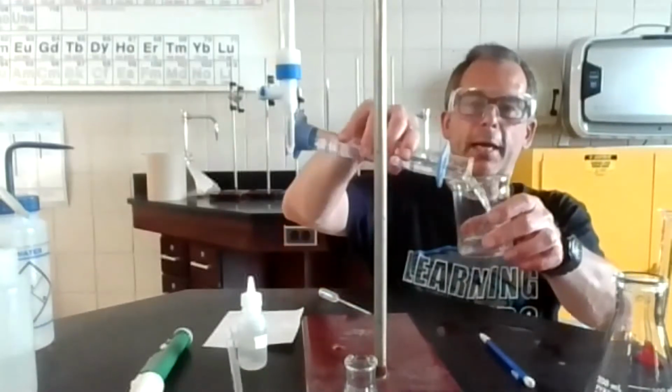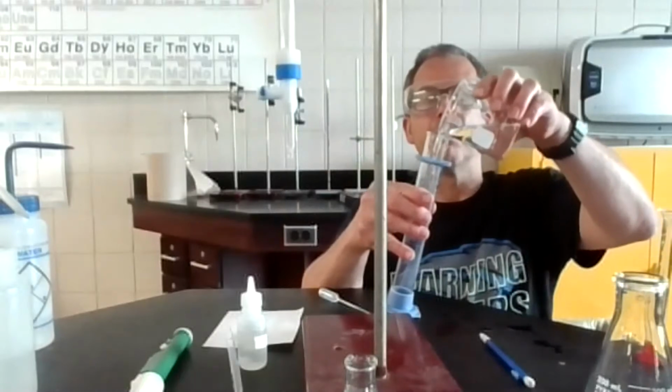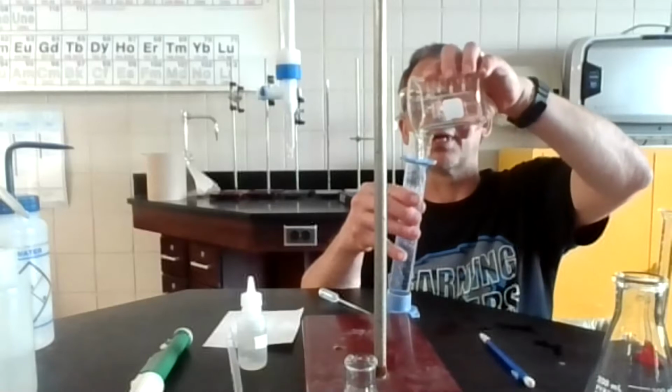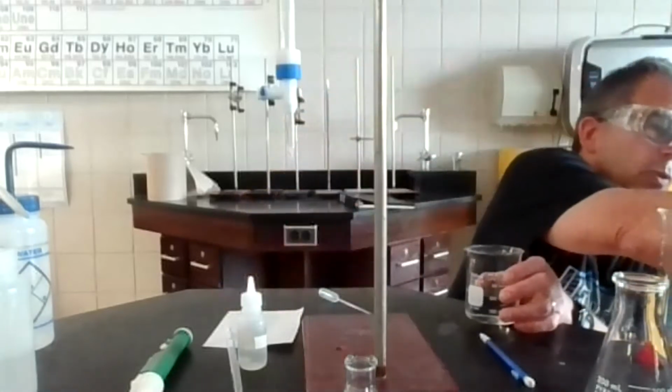And now I'm going to pour it back in here. Okay, and then I'm going to pour it back in here because I know that might not be mixed real well. It's really hard to mix in a grad cylinder. I don't know if I really have to pour it back into the grad cylinder. I'm probably going to just stir it around. And I like to keep it in the beaker. So now I know that's mixed well.